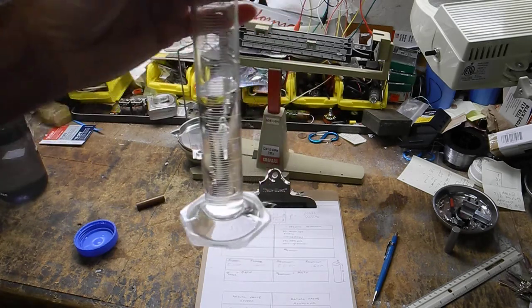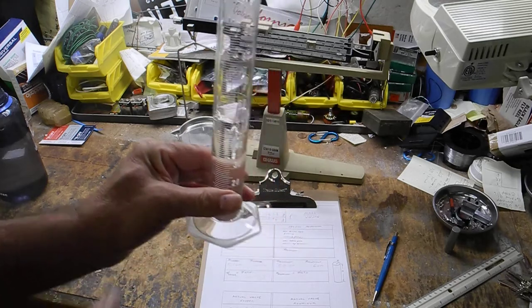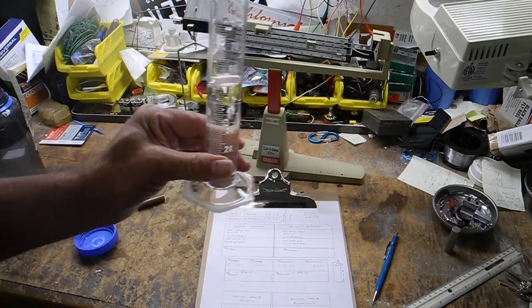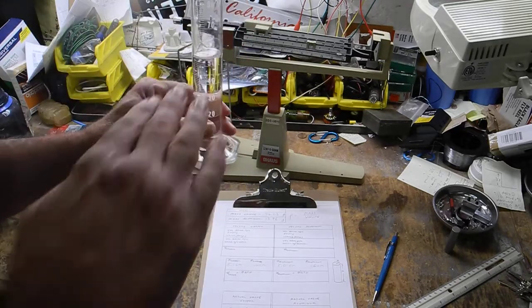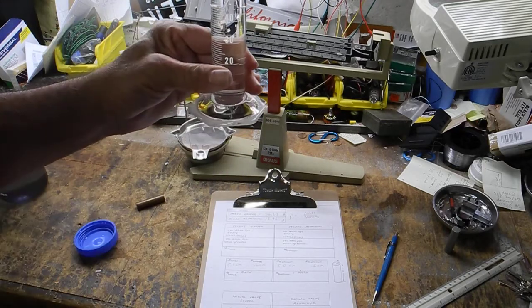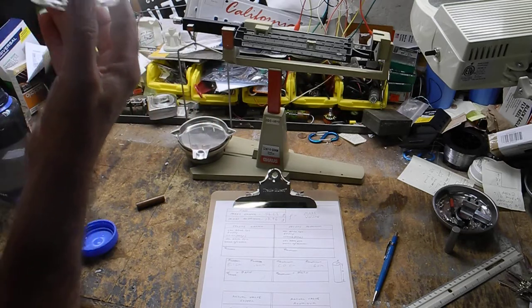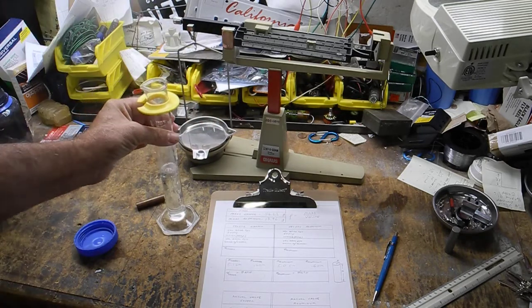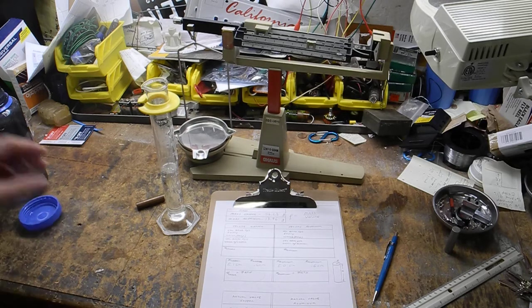Got a couple bubbles. Now, when you read a graduated cylinder, you read by the bottom of the meniscus, right? There's a curve here, and I can't really hold this in the camera and do it straight on because I need to look at it straight on with my eye. You could see it somewhere above 50, but I'm not sure yet. Let's see what we got. One of the things I don't like to do sometimes is put it on a table and read it, because you don't know if this table is flat. This table might not be level.